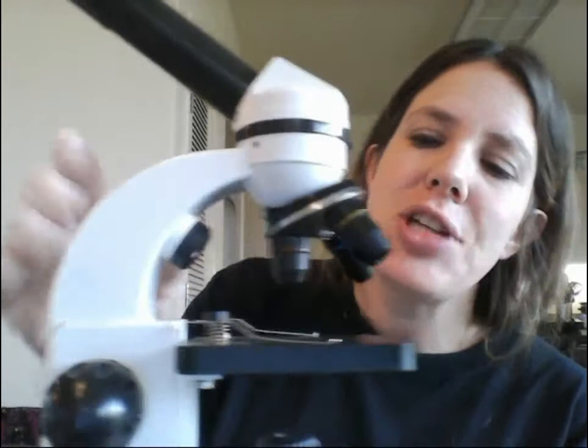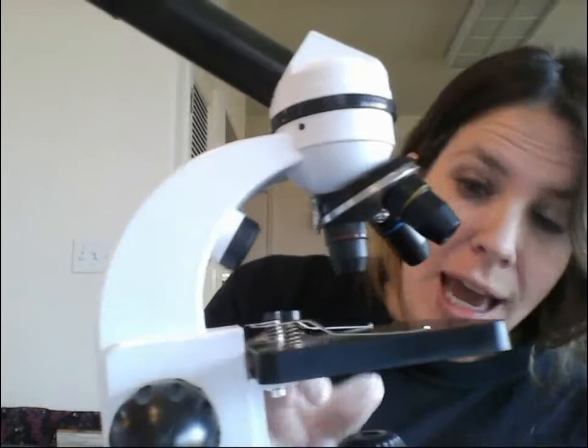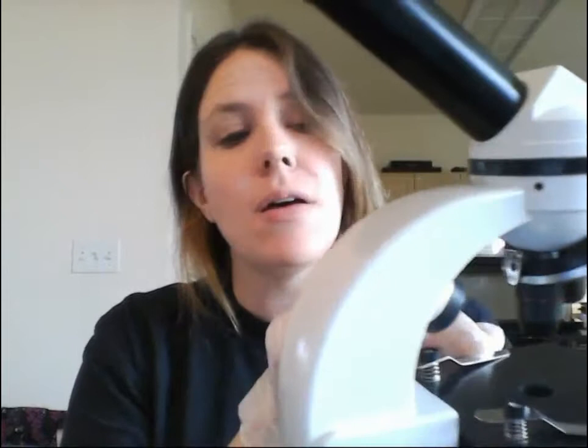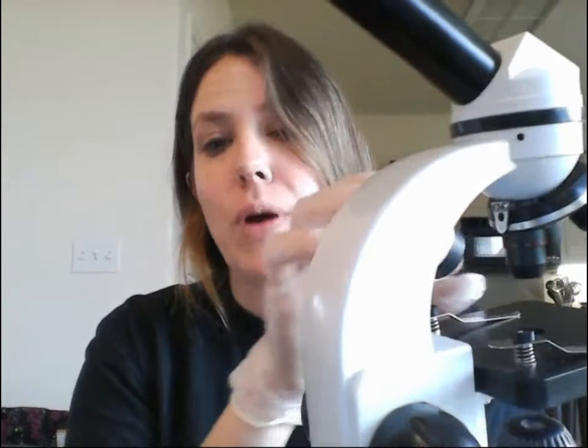This is called the stage. In face-to-face lab microscopes, they usually have mechanical stages with a mechanical stage assembly that lets you move the slide left, right, up, and down using levers. These simpler scopes don't have a mechanical stage assembly, so it's a hand stage. When you put your specimen on, you have to use your fingers to slide it around under the clips.